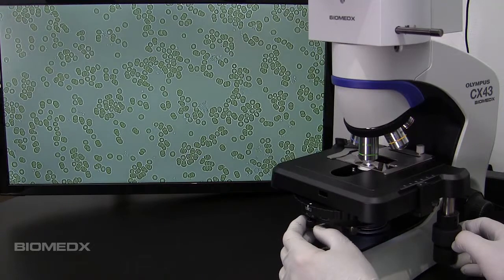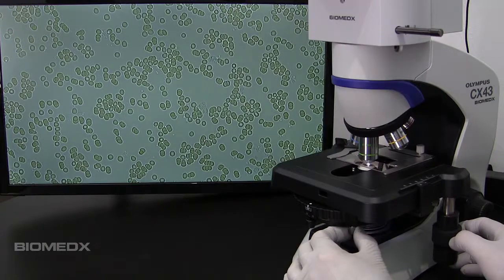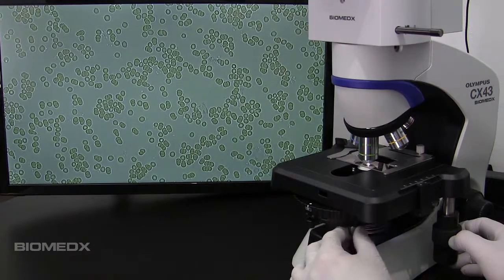This right here is brightfield mode. Typically that needs a little condenser iris adjustment to get some detail and depth of field in our specimen.